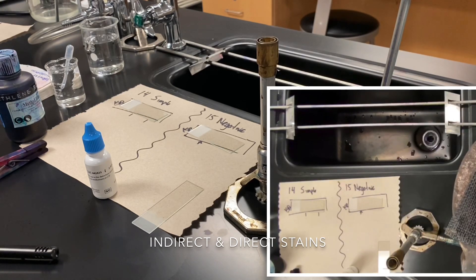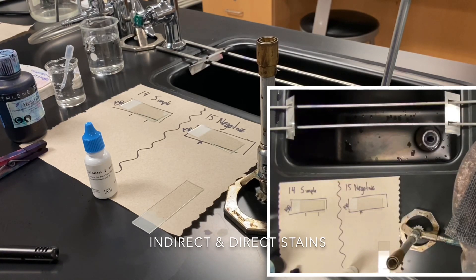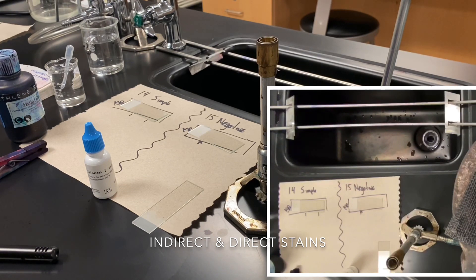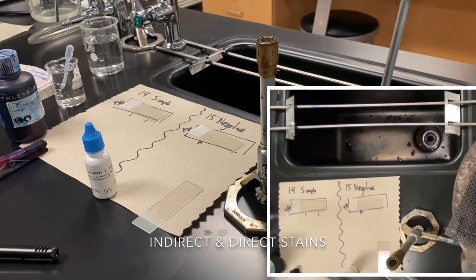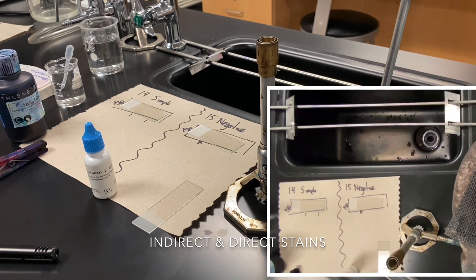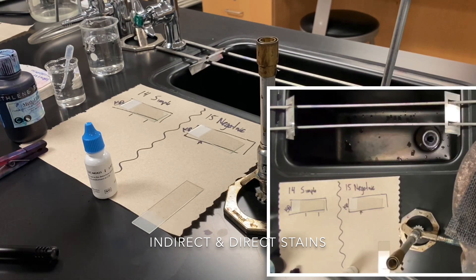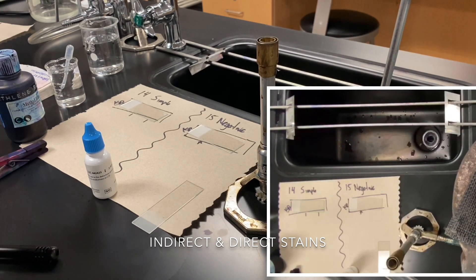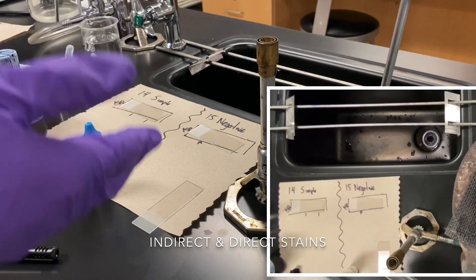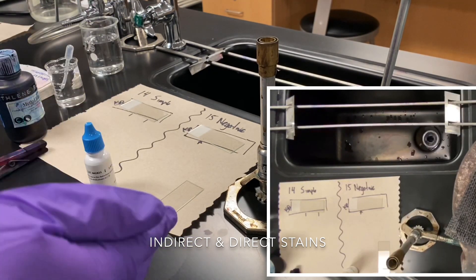We're going to focus on two experiments: Experiment 14, which is our simple stain, and Experiment 15, which is our negative stain. The reason we do these side by side is because they're complementary to each other. One is a simple or direct stain in which we stain the actual cell, whereas a negative stain stains the environment instead of the cell itself.